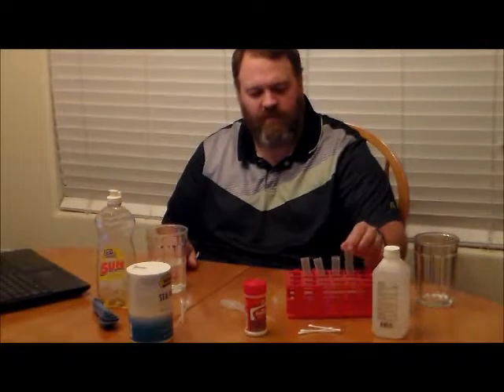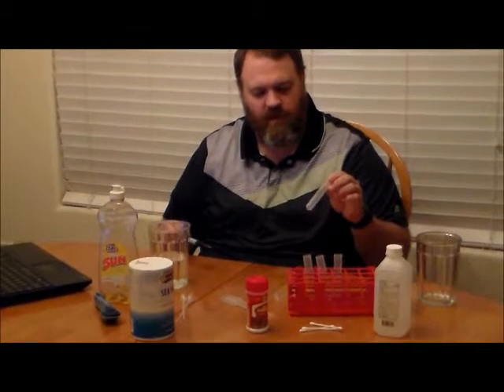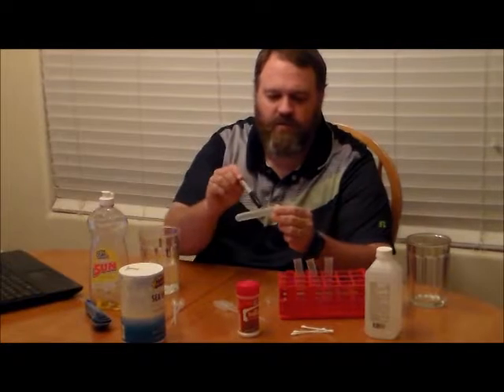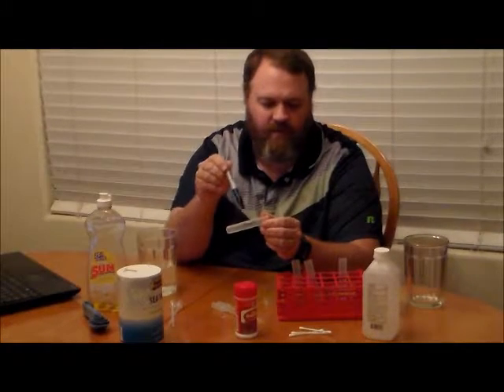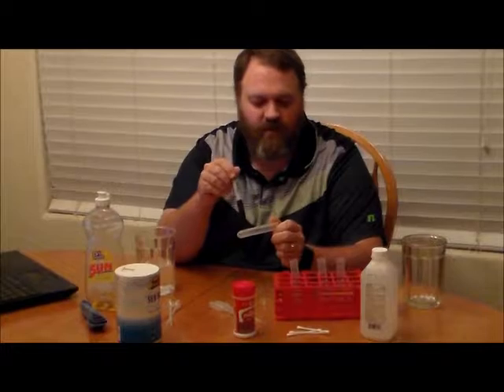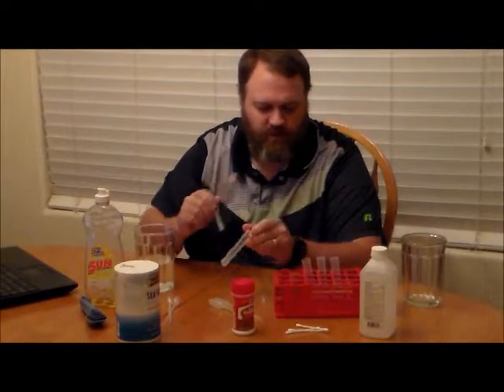Now we're going to mix up some solutions. I've taken my test tubes and my marker, and you'll see I've written some labels on the sides. On one test tube, write 'salt' or 'salt solution.' On one, write 'enzyme' or 'enzyme solution.' On one, write 'cells.' And on one, write 'soap' or 'soap solution.'